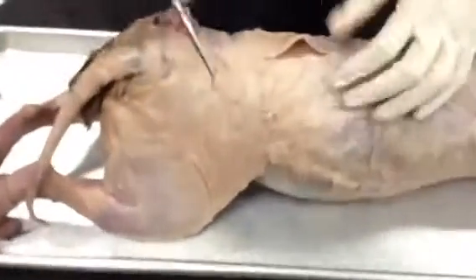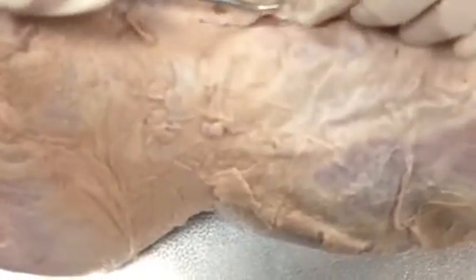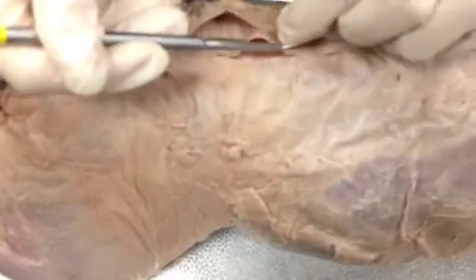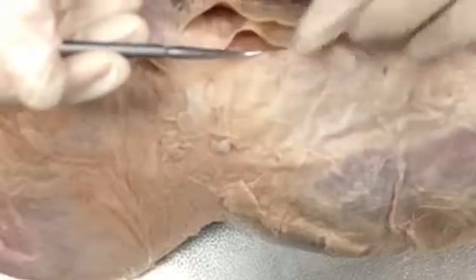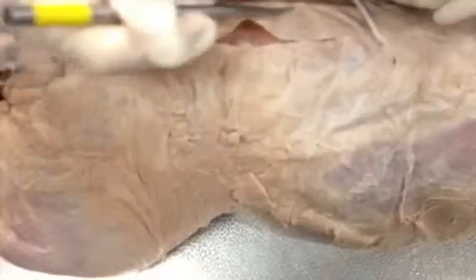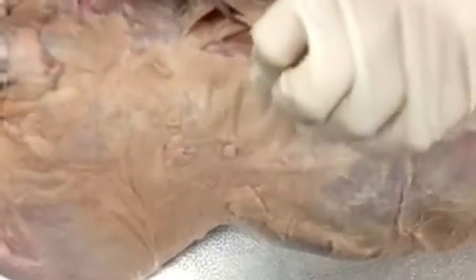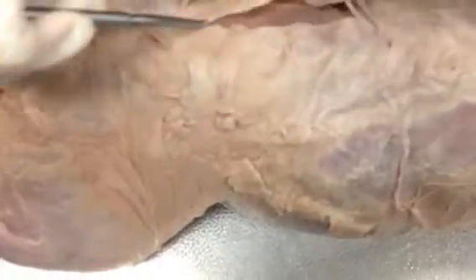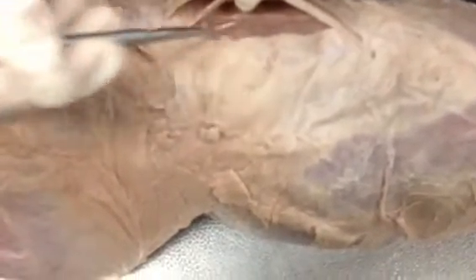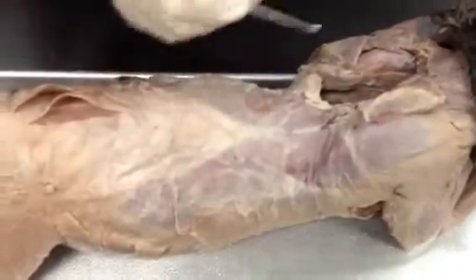Turn them over. Okay. So whenever you're looking at the thoracolumbar fascia, there's a very first layer of it right here that you would cut first, the lamella or lamellae, this first one. And then whenever you cut underneath, it's just another piece of aponeurosis. Under here you can see the erector spinae muscles, and like how the word sounds, they keep your spine erect, and so they go all the way down, and then later they'll break down into other portions, once we get to that part.